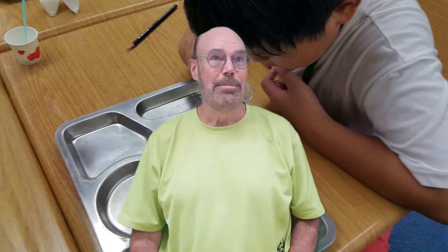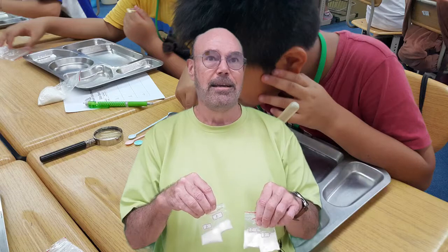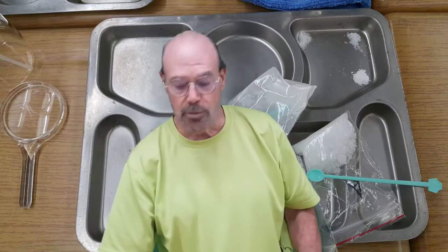Welcome to Science Lab. Today we're going to work with unknown substances. Let's call them A, B, C, and D. We will do different tests on each substance and record what we see on our data sheet. After we finish testing all of the substances, I will mix two of them together and you will test the mixture to tell me what they are.